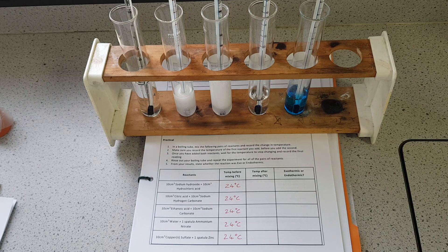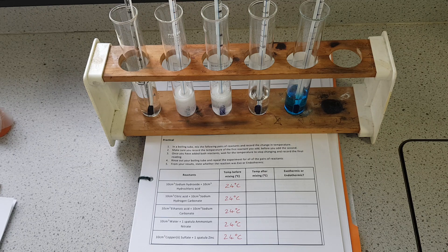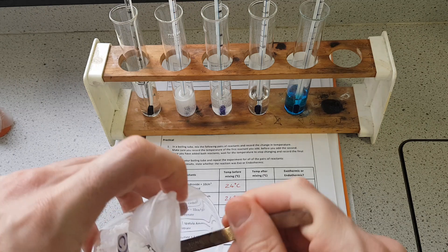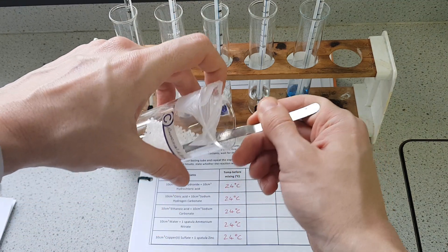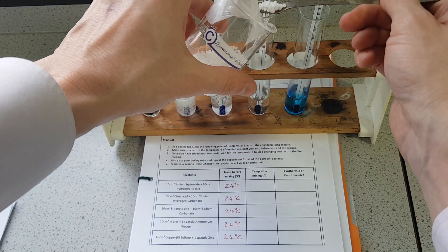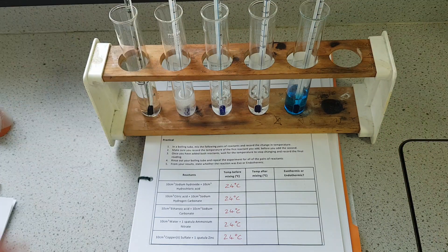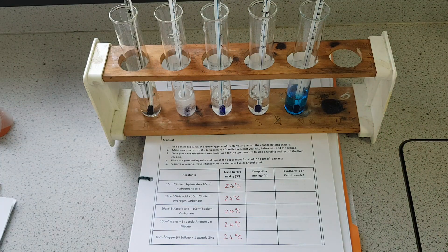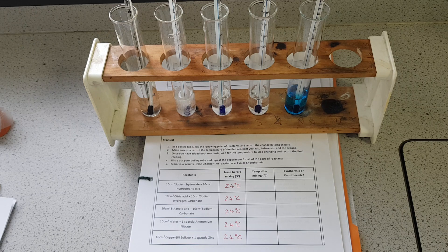To the water I'm going to add some ammonium nitrate — again one spatula's worth. These are little pellets, so that takes a moment. And finally some zinc granules to that last boiling tube.